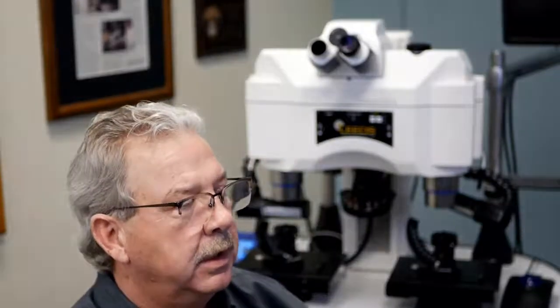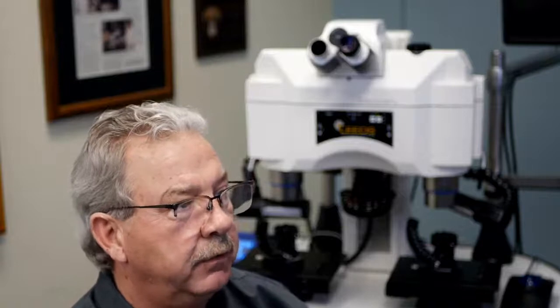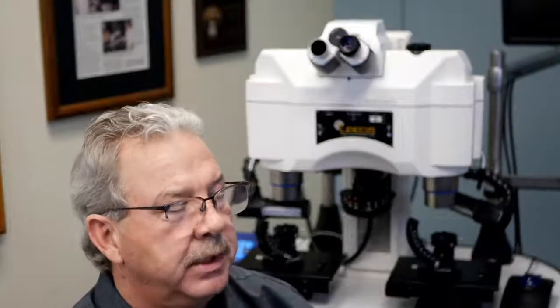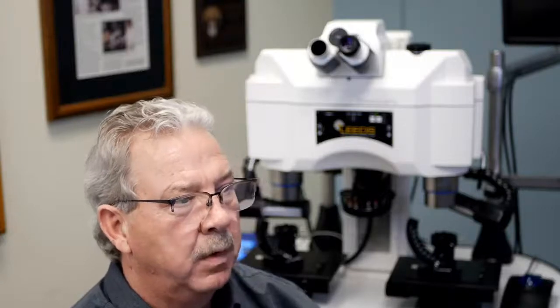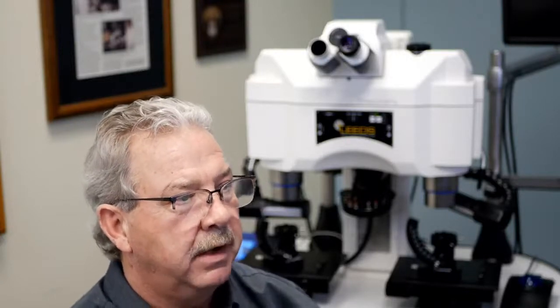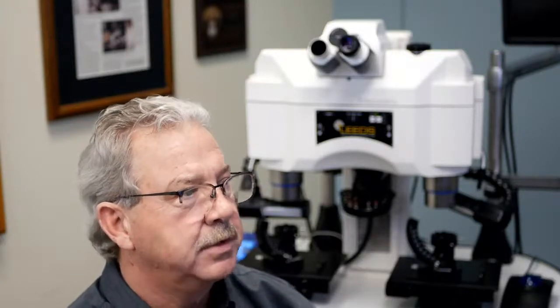So let's just go through a little bit of nomenclature here. The common nomenclature to describe the effective viewing area of an eyepiece includes different terms. That would be field of view, which you may see abbreviated as FOV, or with actual periods after it, so it looks like a true abbreviation.